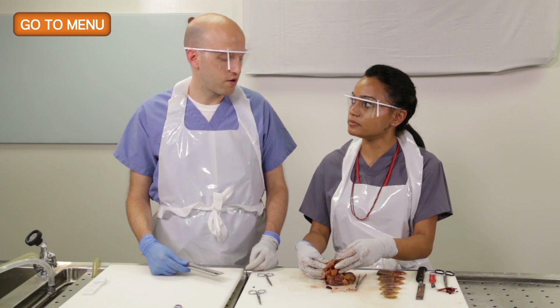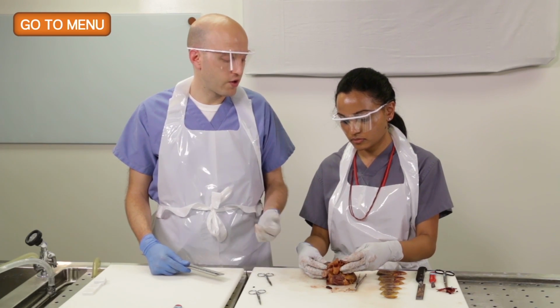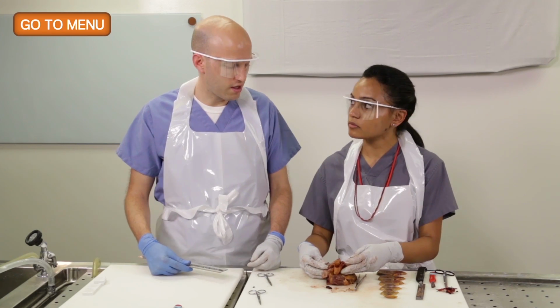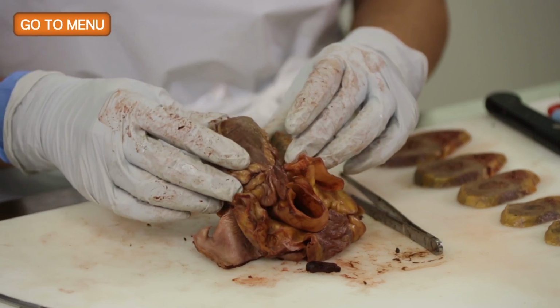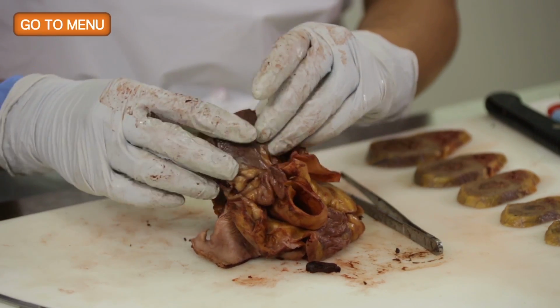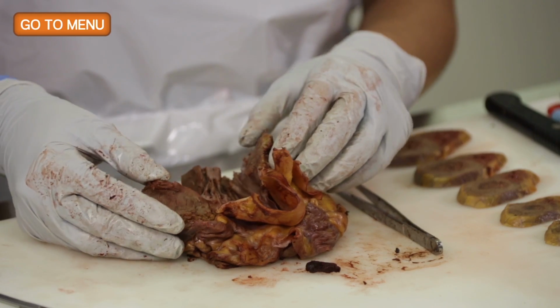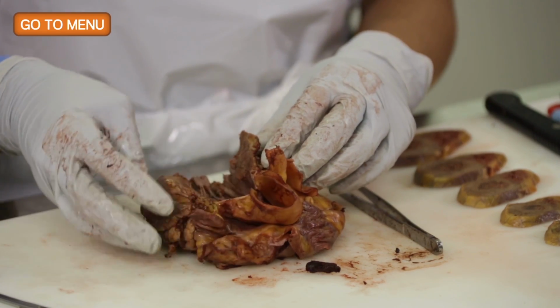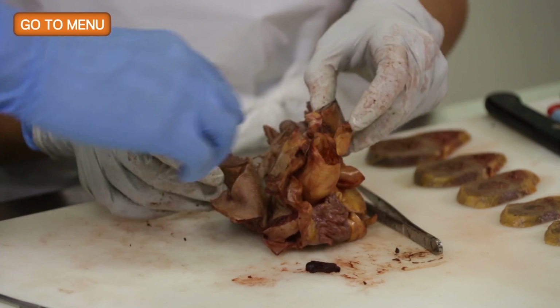It's a normal size heart for a man, yeah. Maybe slightly too large, but the very large hearts can be up to 3 times this size. So the left ventricular thickness should really correlate with the weight of the heart. So we're looking at a normal weighted heart, we would think the left ventricle should be in the normal range. So let's do it. I think it's best to go from this side.